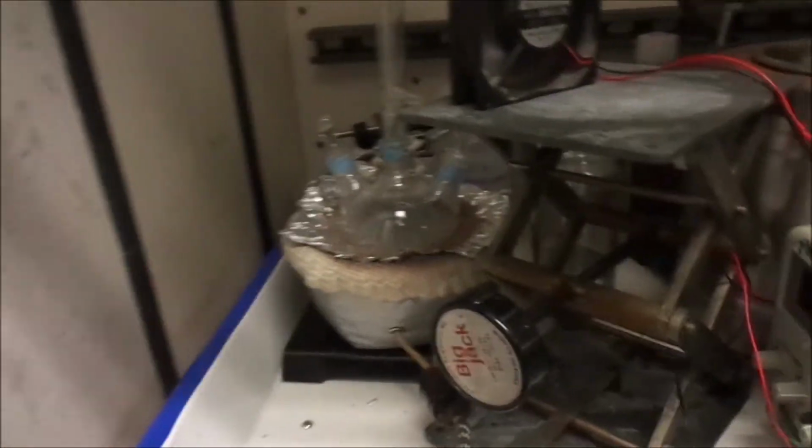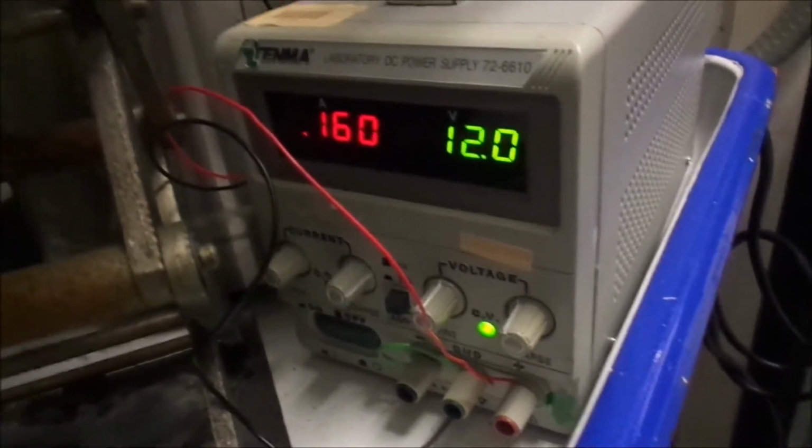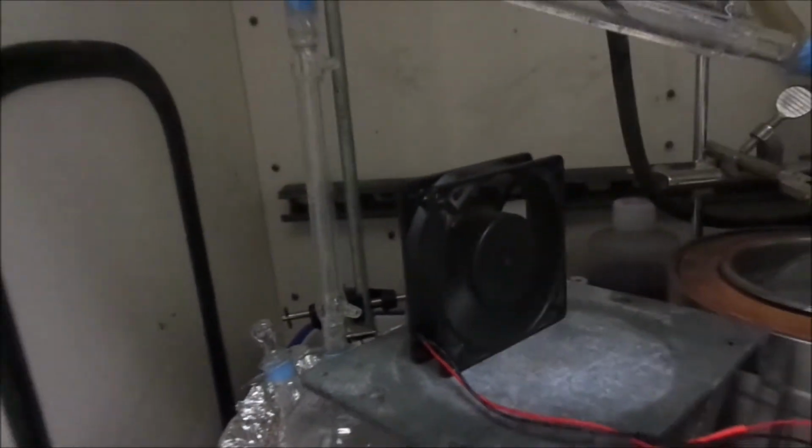So go ahead and we'll get this thing set up. So here's the final setup on this thing. There's the power supply, set to 12 volts, only drawing a little less than 2/10 of an amp, running our fan here. I gotta get the temperature back up because I had to go to the lab to locate that power supply and find that fan. Looking for this stuff, it had to run without heat. You can't have mercury distillation running on its own, so I had to shut it down. It's just gonna take a few minutes to get back up to temperature. So we'll find out pretty quick whether or not this is gonna work.